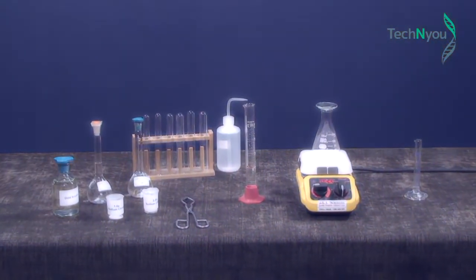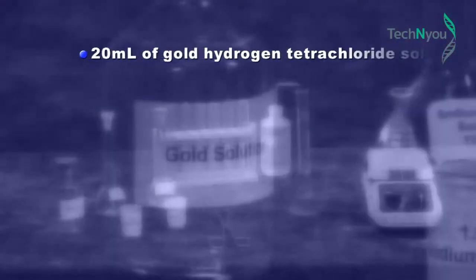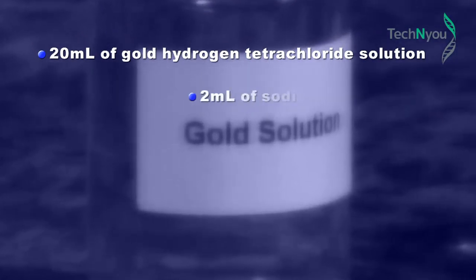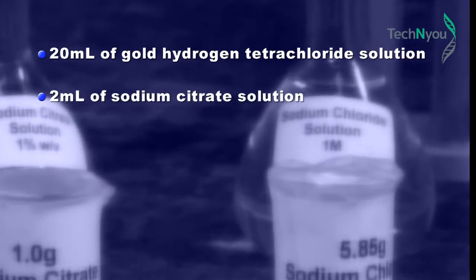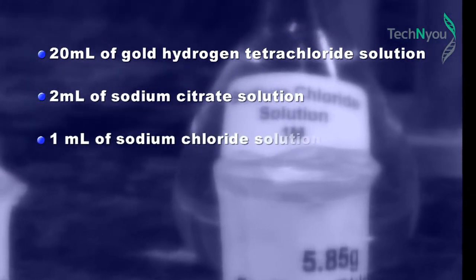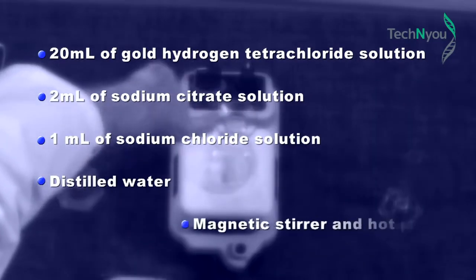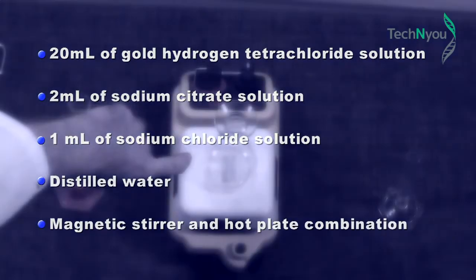The solutions and equipment are 20 ml of gold hydrogen tetrachloride solution, 2 ml of sodium citrate solution, 1 ml of sodium chloride solution, distilled water, magnetic stirrer and hot plate combination.